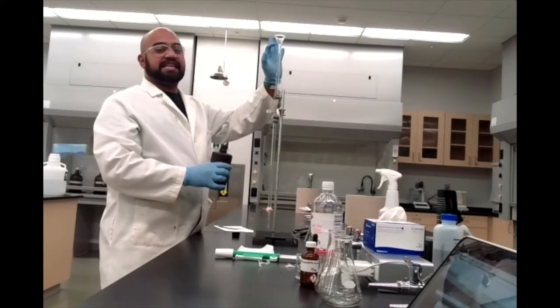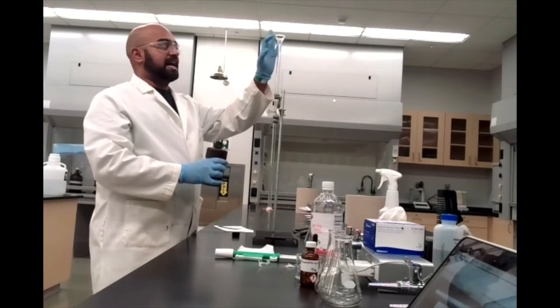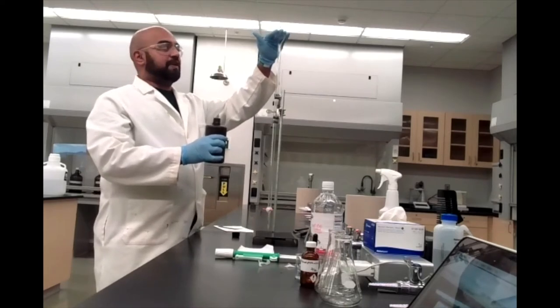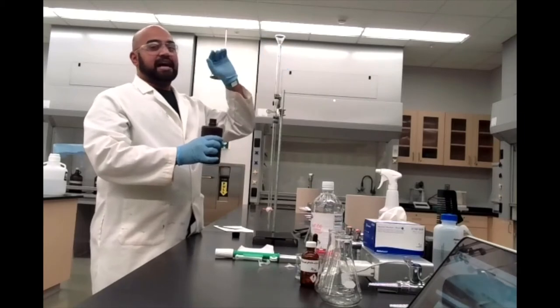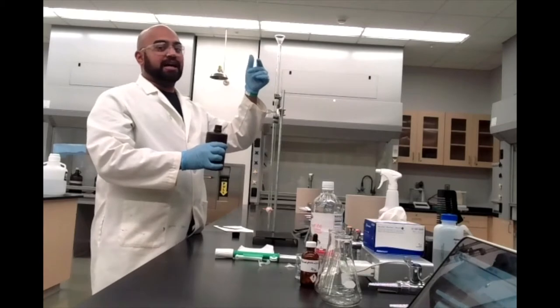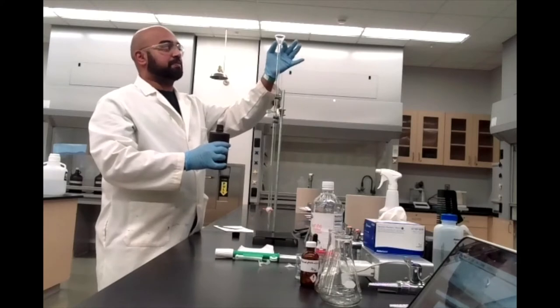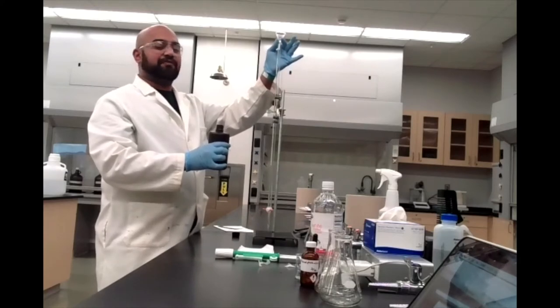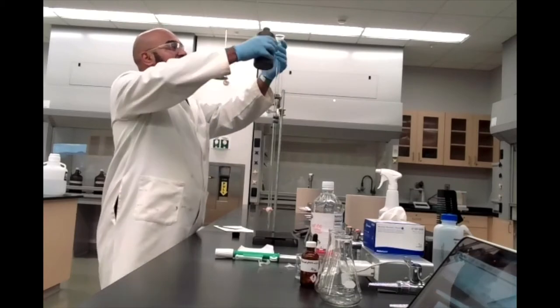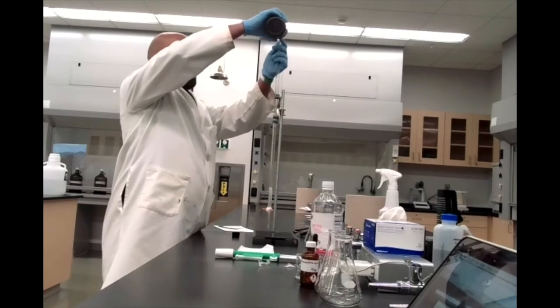Given the narrowness of the bore of your burette, if you just pour in your sodium hydroxide with the funnel sitting flat, it tends to not allow the air inside to escape and you overflow from the funnel. So it's better to lift the funnel very slightly when pouring. This is also why it's good to wear gloves when doing this.